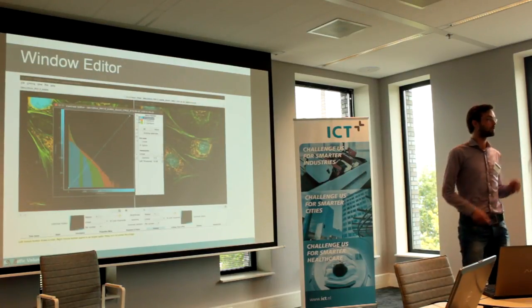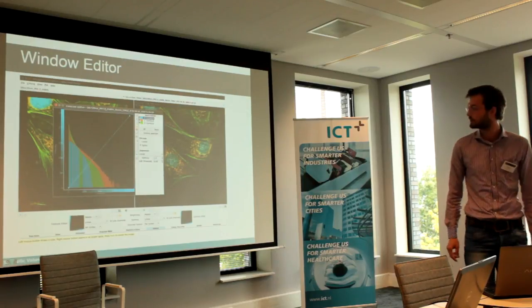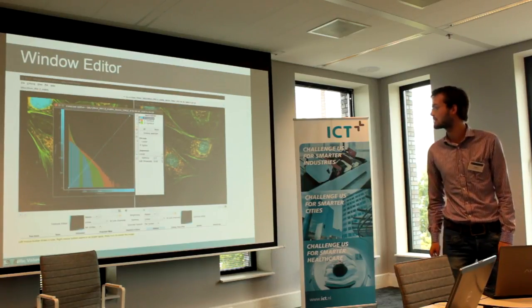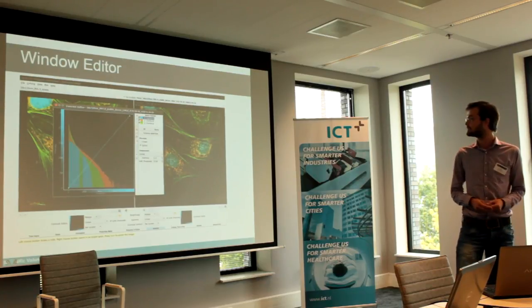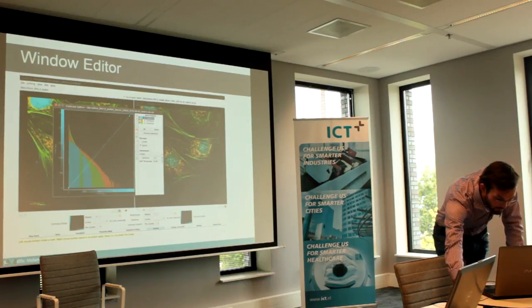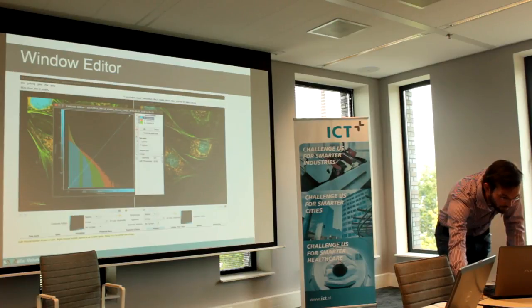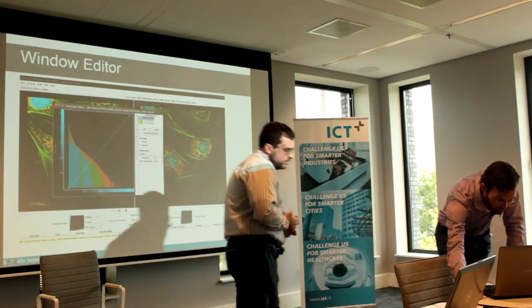I just started working for the company on the 1st of January. So this was one of my first projects. I made a window editor, and that means actually that we can change the contrast in the images. So I'll just show you, it's easy stuff, but then you actually know what the user can do in our software. Is it working?